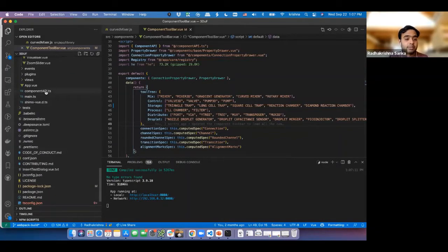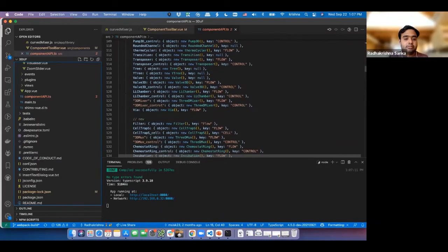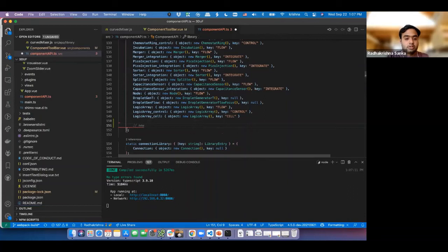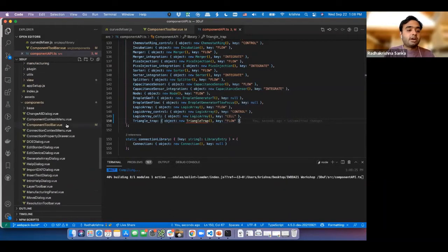In order to do that, I'm going to go to what we call the component API. And then I'm going to add a new item to the library called triangle trap. I can pretty much add it anywhere I want. By just repeating the data structure that is over here, there you go. I love autocomplete because it makes life so much easier. It's saying, okay, this is triangle trap, but I don't know what triangle trap is, because we didn't create a component definition called triangle trap.